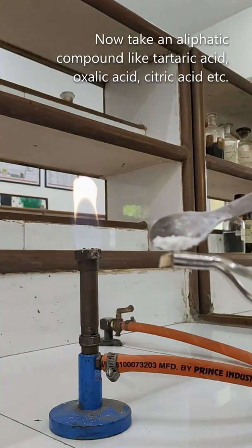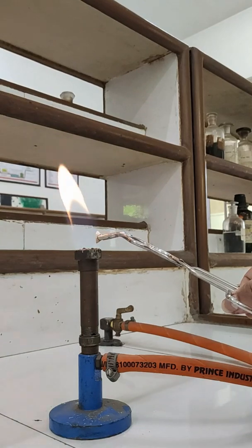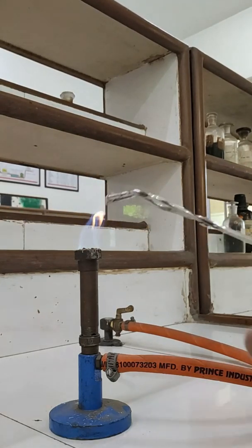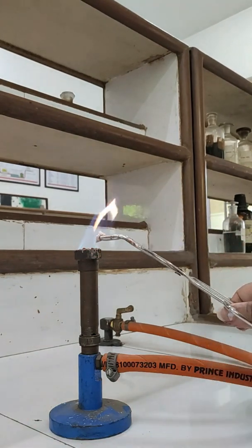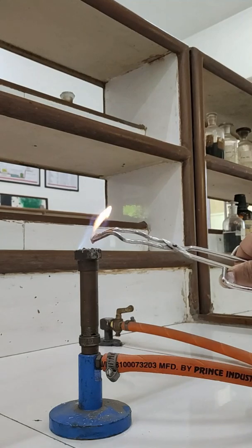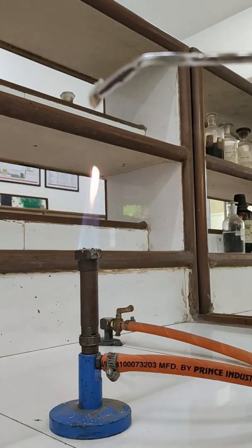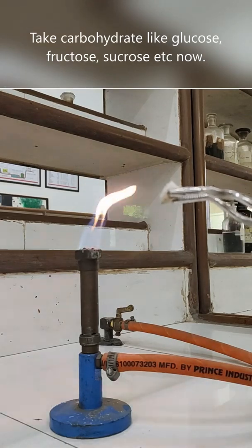Now let us check how an aliphatic compound is going to behave. On the porcelain piece, take the compound and let it come in direct contact with fire and observe. You can use a glass rod or a porcelain piece — today I will show only solid compounds. Now observe: there is no black residue on the porcelain piece. Add more of the compound and heat again. If it is aromatic it will give you either a black residue or a black sooty flame. But look — there is no black color and the flame is also non-sooty; it is all white flame. That confirms it is an aliphatic compound.